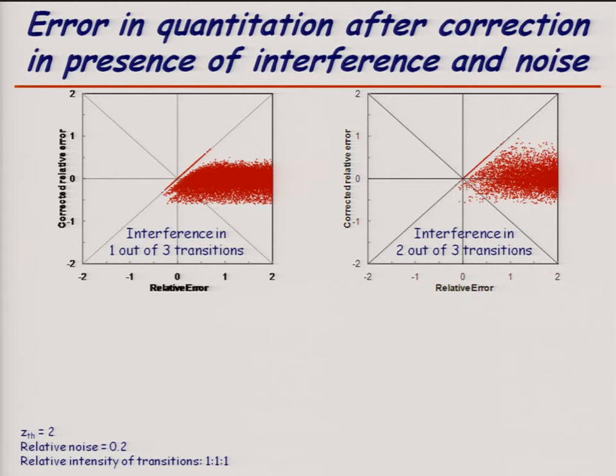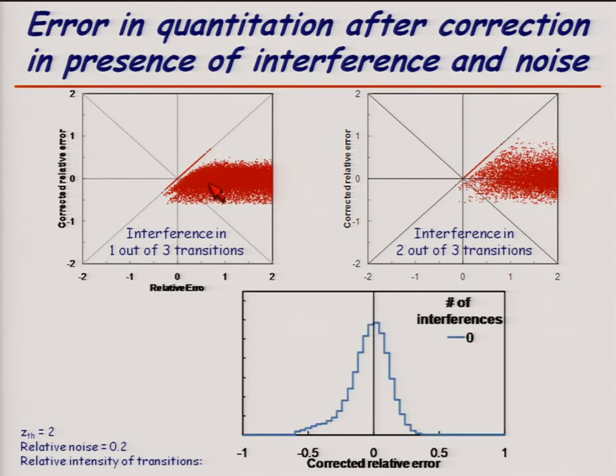So now we looked at interference in 1 peak. If we move to interference in 2 peaks, this is the old data that I showed before, 1 interference out of 3 transitions. Now we have a much worse case where we have 2 interferences out of 3 transitions. You see that we get a quite wider distribution here, and if we look at this in detail, this is comparing it to the case when there is no interference, only noise, and then 1 interference here, and then again 2 interferences. We see that we can do some correction even in that case, but we do get quite a wide error distribution. And probably in this case it's better just to reject the data completely and say that if we don't have at least 2 transitions that agree and don't have interference, then one should probably just throw away the whole measurement.